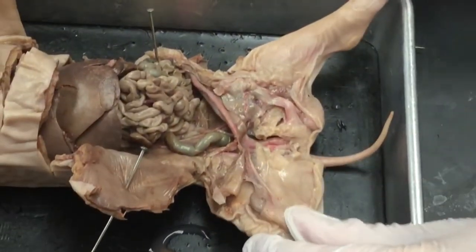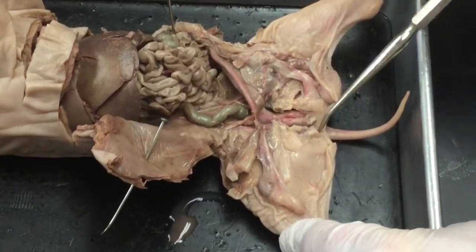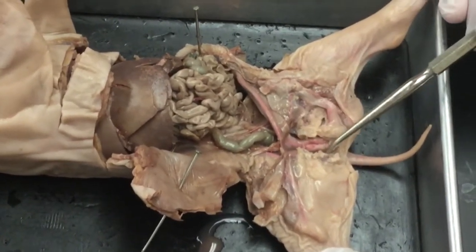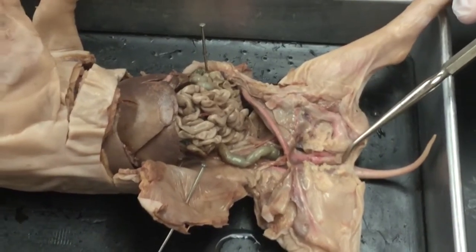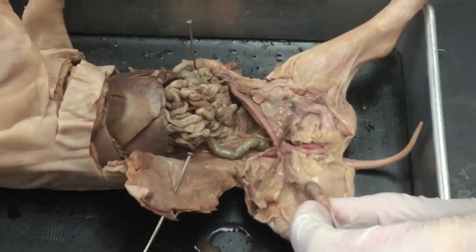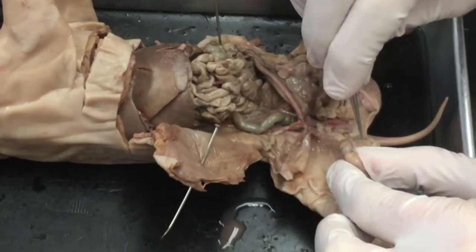Okay, ladies, so here we are with the male completely opened up, cut through the bone. So you'll cut through muscle, you'll see this, and you'll see it looks a little mutilated here, but there's a pubic bone here that you have to cut through in order to expose this area. So again, just to reorient, this is the testis. And so we were removing some of the film, and I had removed some of it, but I wanted you to be able to see how thin it is.